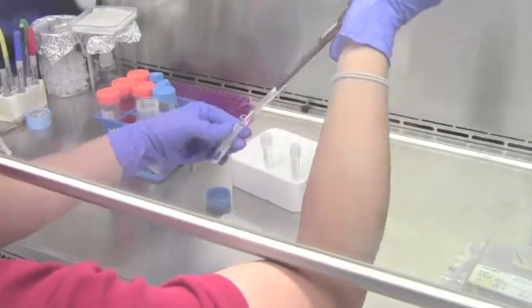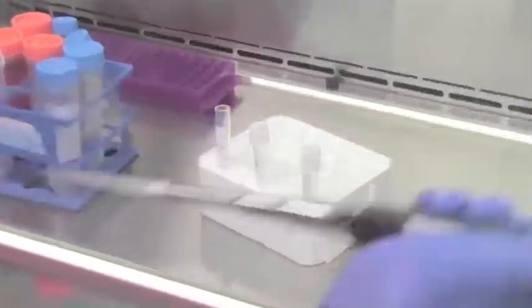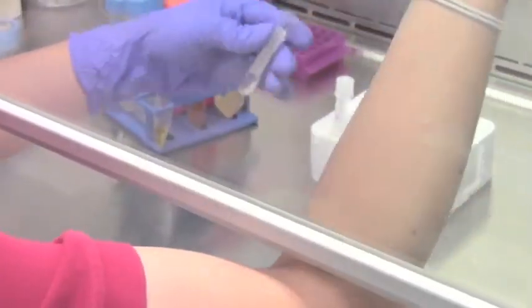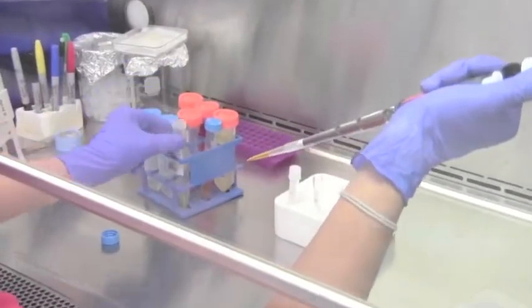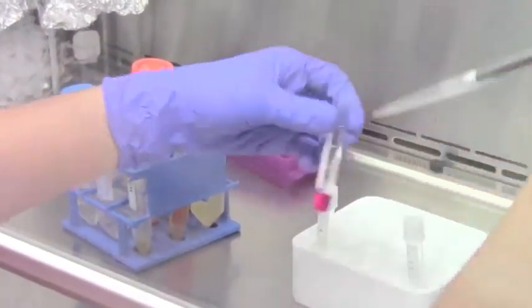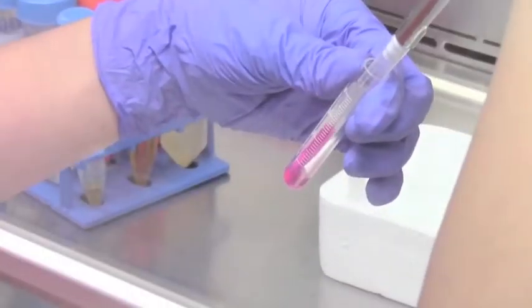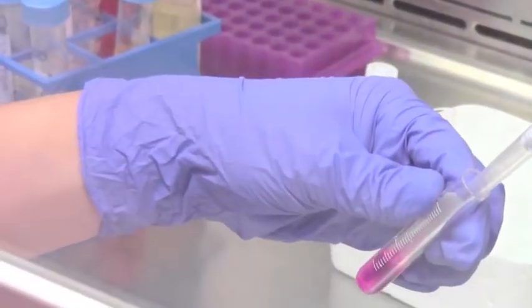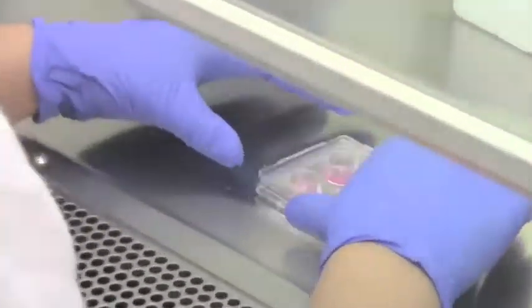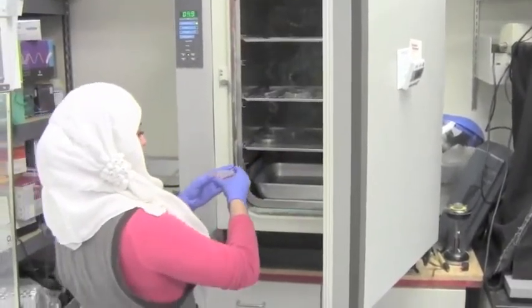To make the collagen gel, we have three tubes. The first tube combines water and the rat tail collagen. The second tube has sodium bicarbonate and M199 media. Adding tube C combines the solution of tubes A and B. We pipette the solution into a four-well plate, swirl them around to evenly distribute the solution, then incubate the gel in order to allow it to polymerize.